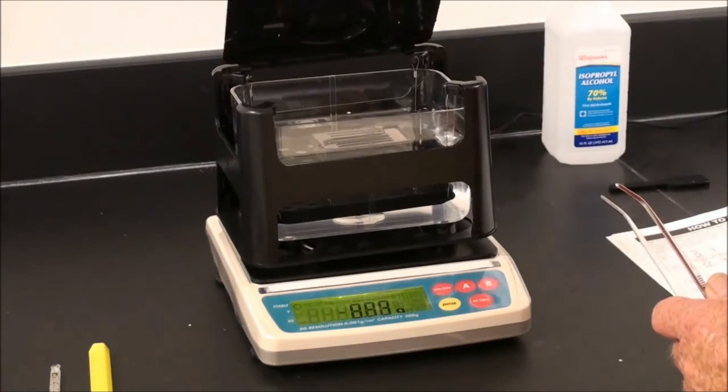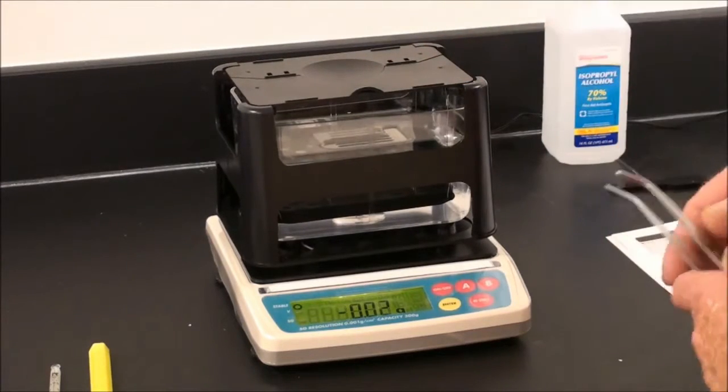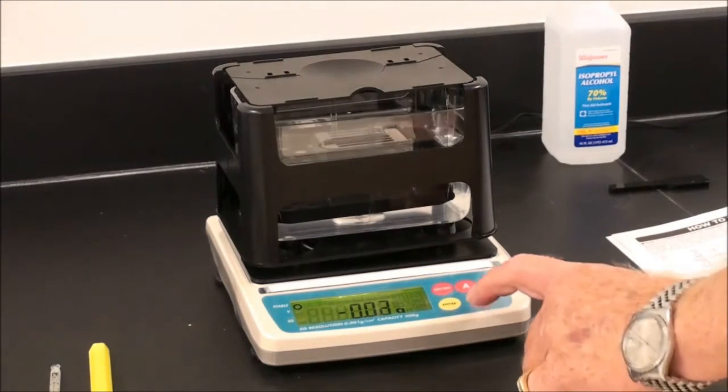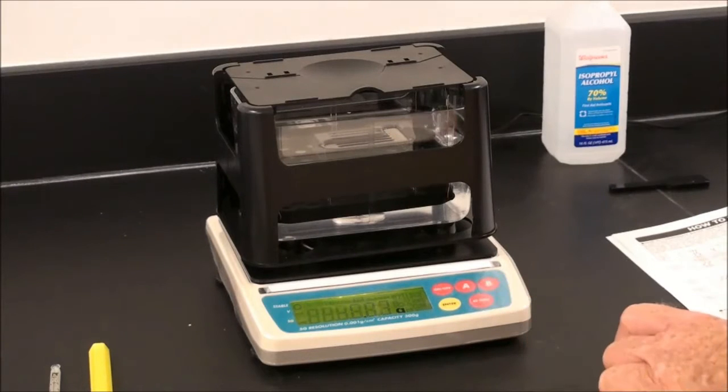Close the sensor stage, re-zero, and we're ready for the first weighing operation.